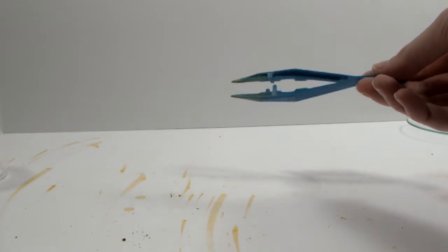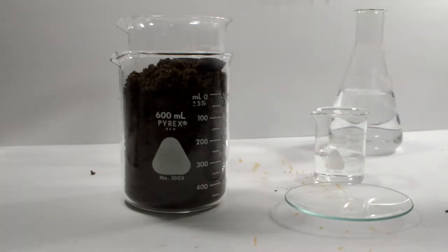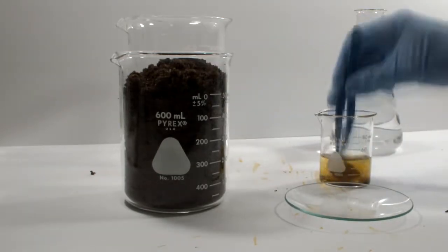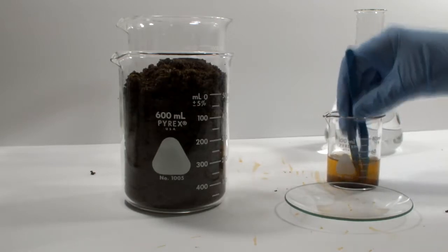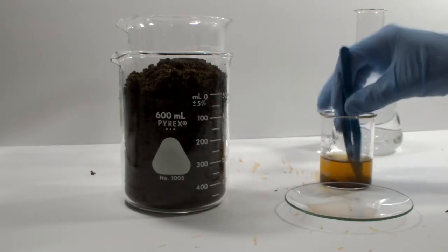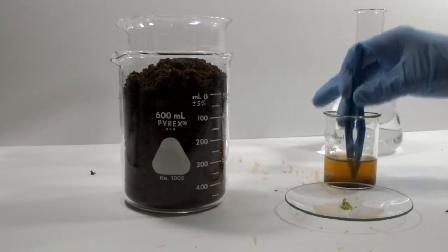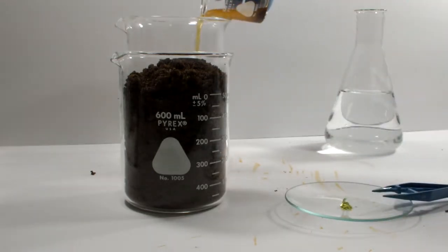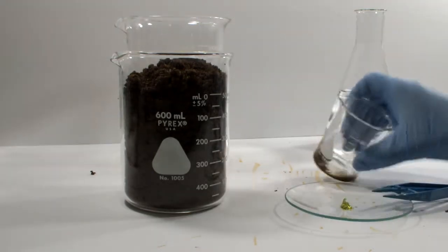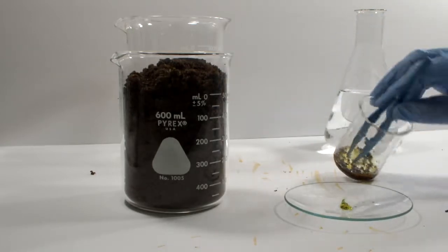My poor plastic forceps have been discolored and slightly melted for nothing. So here's the unfortunate procedure. Pour a little bit of water into a beaker, grab a chunk of the garbage stuff, smash it around for a little while, fish out a crystal of the desirable product, put it on a watch glass, decant the water, inspect the residue, wash it a few times, and then notice that the crystal on the watch glass has dissolved into the very water that came with it when I set it down.